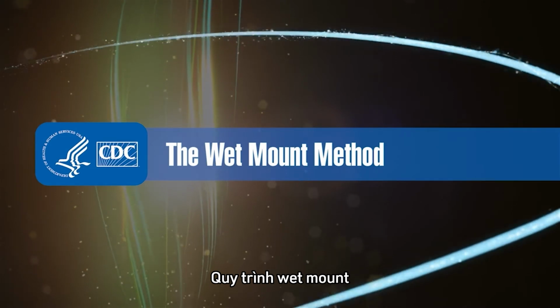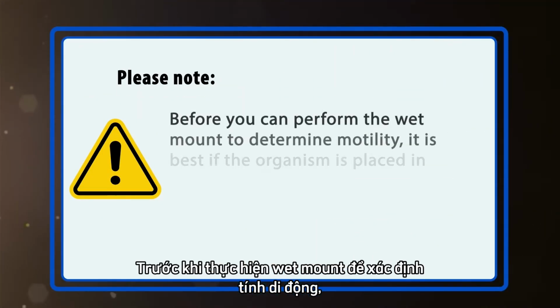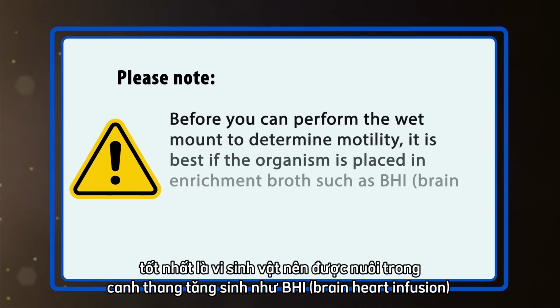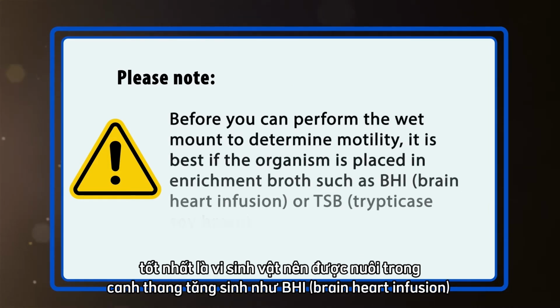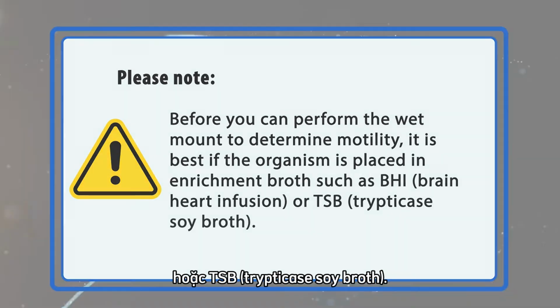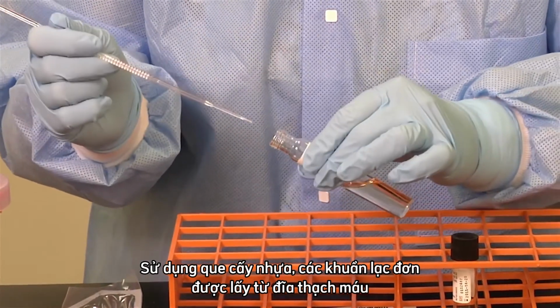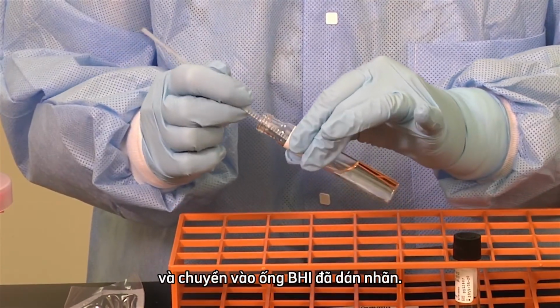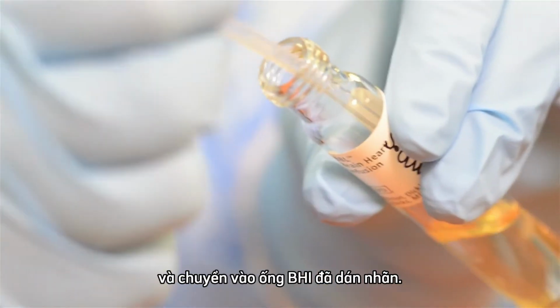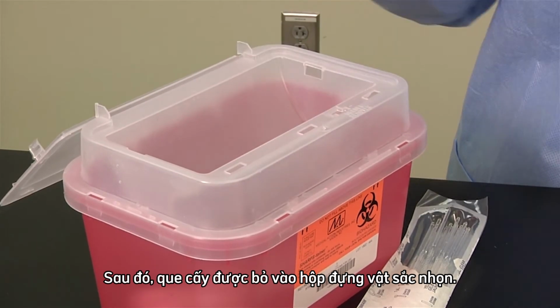Wet mount procedure. Before you perform the wet mount to determine motility, it is best if the organism is placed in an enrichment broth such as BHI, brain heart infusion, or TSB, trypticase soy broth. Using a plastic loop, isolated colonies are picked from a blood agar plate and transferred to a labeled tube of BHI broth. The loop is then discarded into the sharps container.